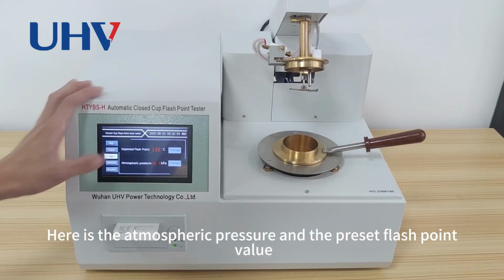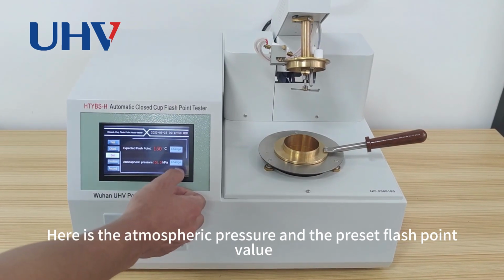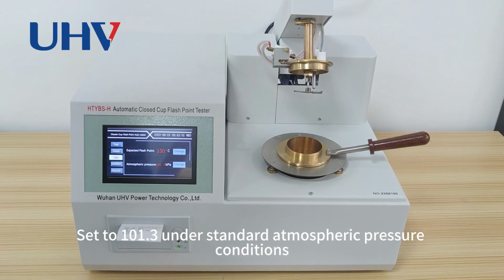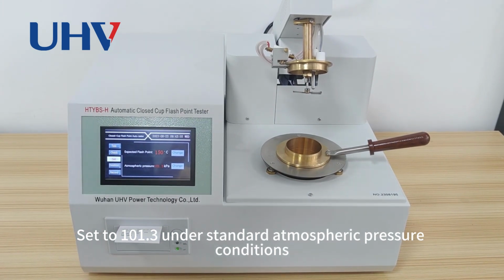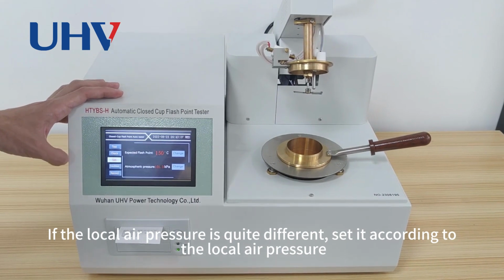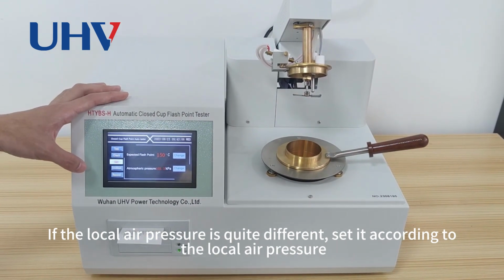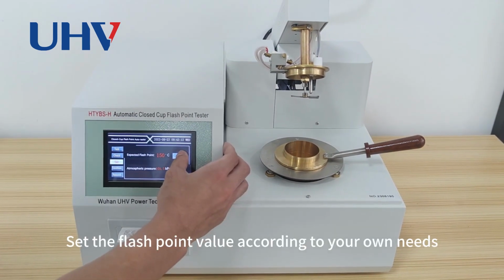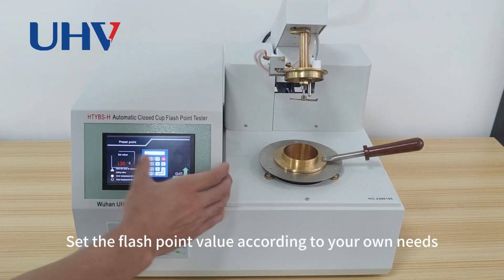Here is the atmospheric pressure and the preset flash point value. Set to 101.3 under standard atmospheric pressure conditions. If the local air pressure is quite different, set it according to the local air pressure. Set the flash point value according to your own needs.